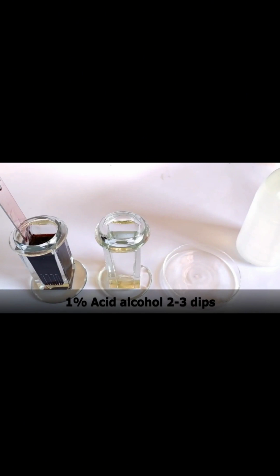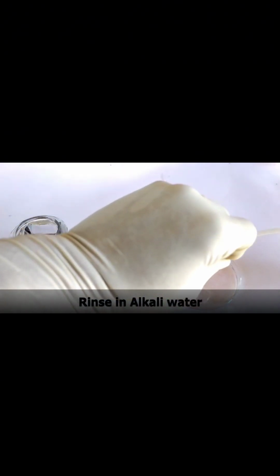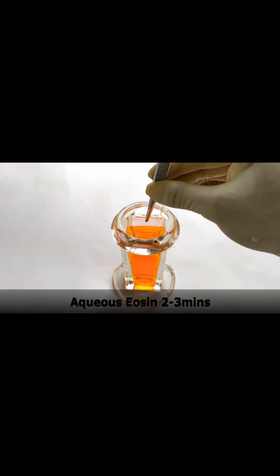Remove the slide and give it 2 to 3 quick dips in 1% acid alcohol solution. Rinse the slide with slightly alkaline water or with 0.2% ammonia water. The stained smear now becomes bluish. Transfer the slide into eosin stain solution and leave it for 2 to 3 minutes.